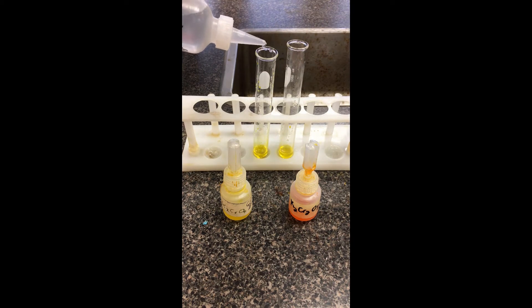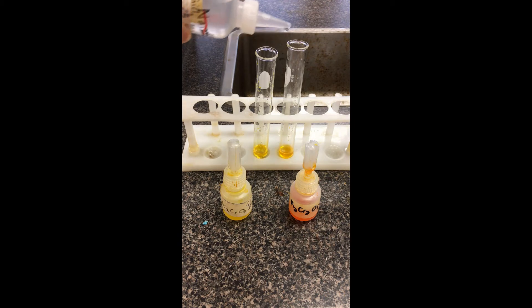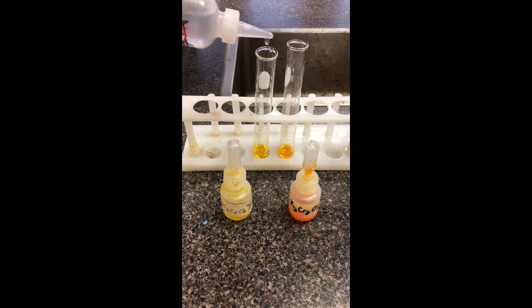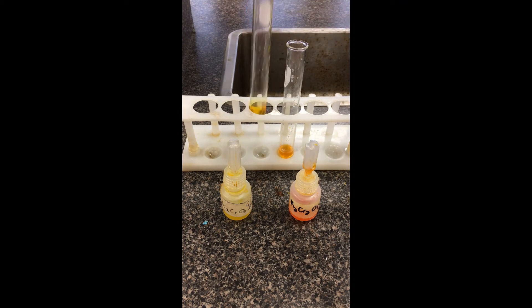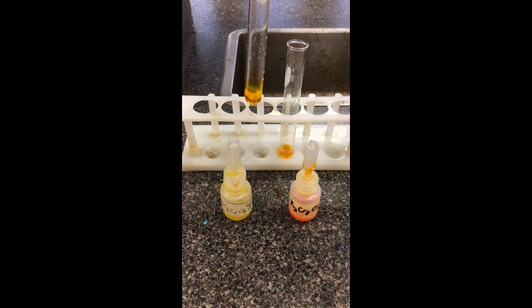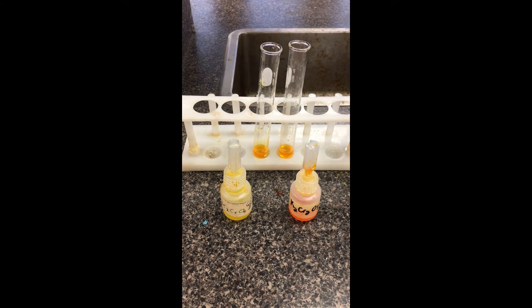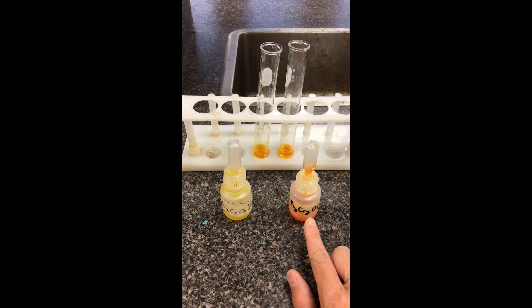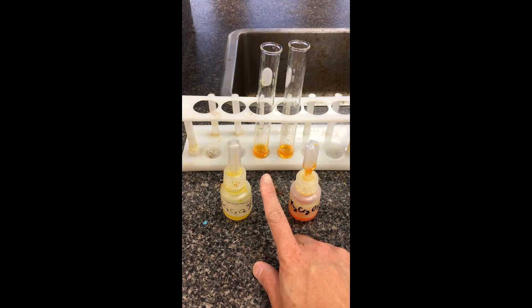Adding drops to each test tube. You should be able to see the color changes already happening. Just going to swirl it up so you can see a little bit better. And this time you can see actually both of them have turned to an orange color — the dichromate has returned to orange, while the chromate solution has also changed to an orange color.